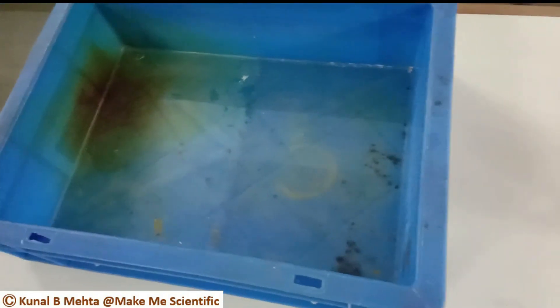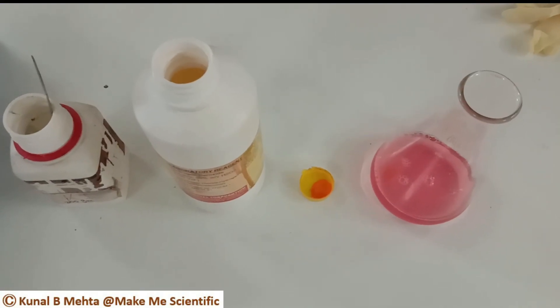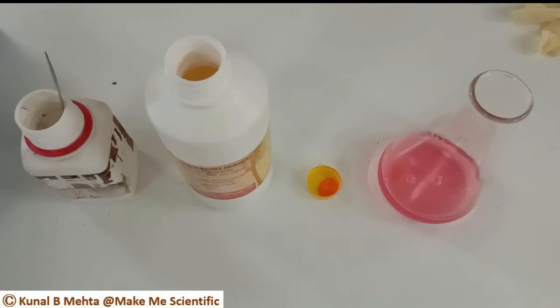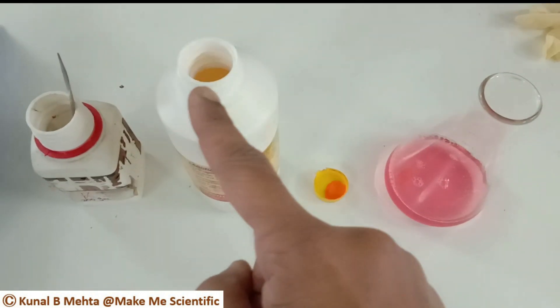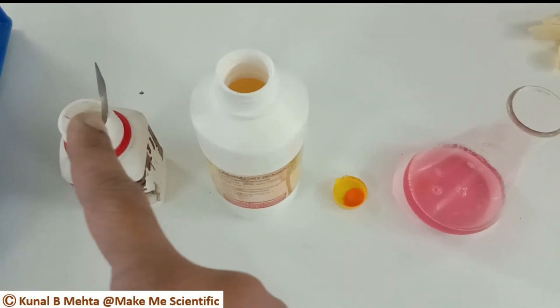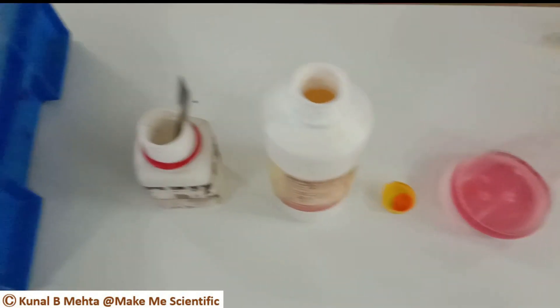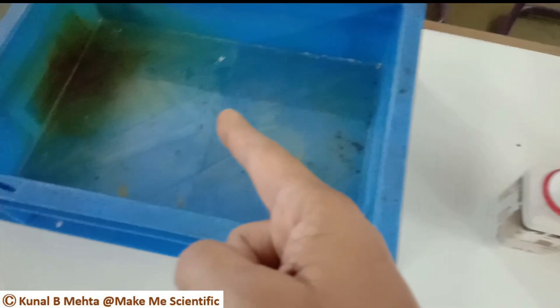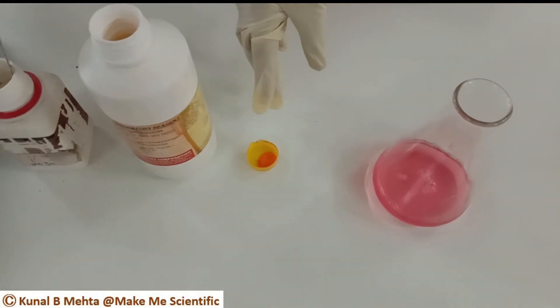I have taken a big plastic container in which the reaction can happen. First, I am going to add the yellow food coloring powder into the liquid hand wash, then hydrogen peroxide, followed by the potassium iodide. A plastic tray is used so that the components don't get spilled over.